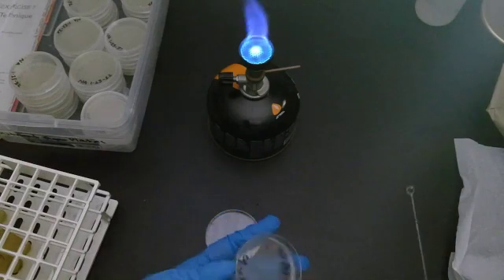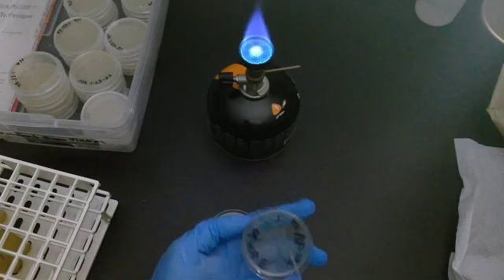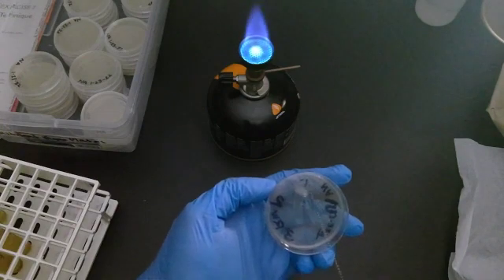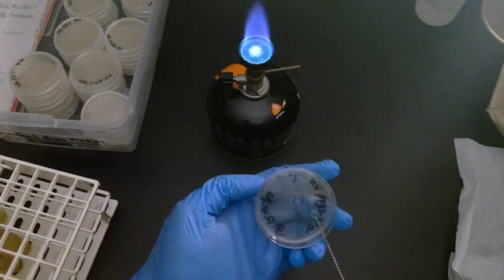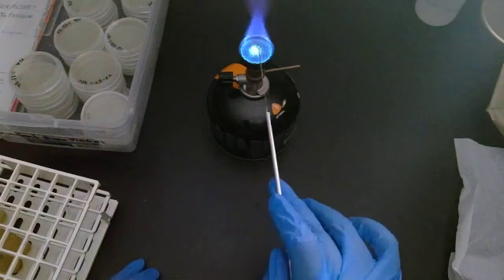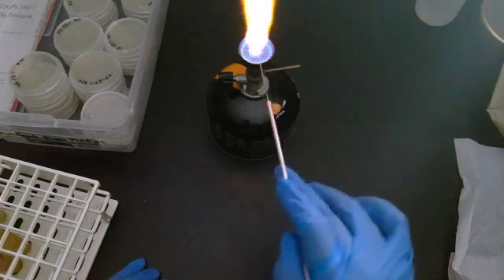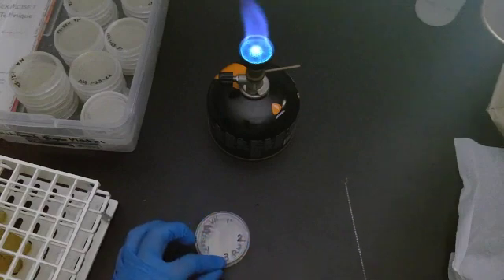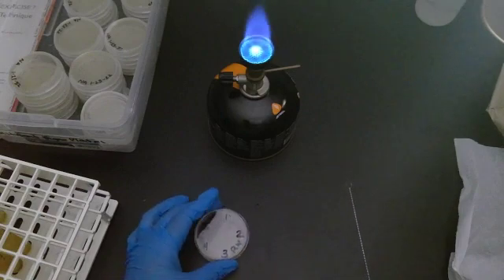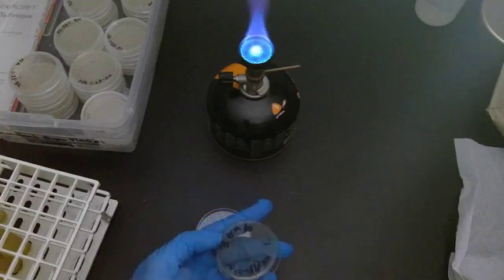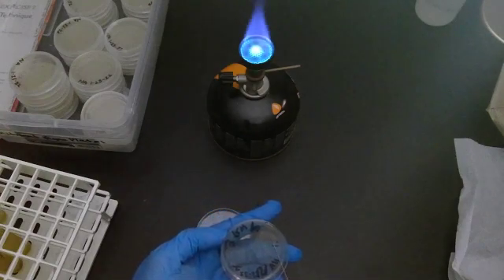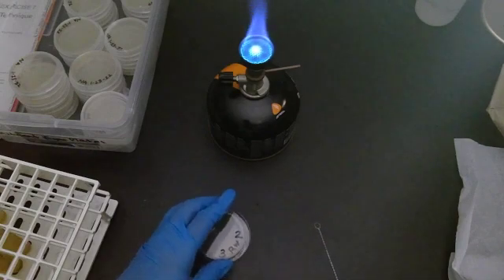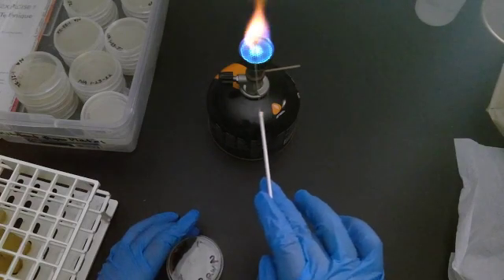This is now sterile. You're going to go from number one to number two and drag: one, two, three, four, five. Now where is number two? Number two is here, number three is here. We're going to turn it over and go from number two to number three. We're thinning the herd.